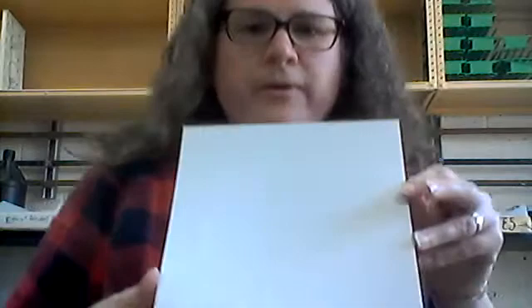We're going to do two different tests. I'll start with the thin layer chromatography. Chromatography is used to separate different molecules within the chromatography solvent as they run up the chromatography sheet, and that can be used to tell you which molecules you have depending on what they look like on the sheet. I've got my sheet all set up — I drew a line across the bottom and that's our origin, and each of the little dashes on there is where I'm going to place a spot of all the different amino acids.